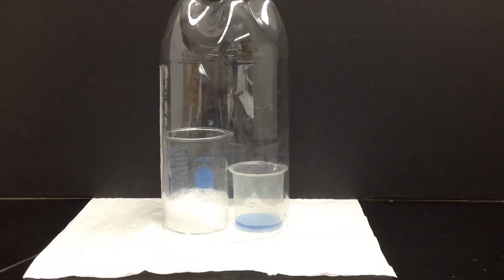So there's all kinds of frothing and bubbling going on over there, and that's an indication of a chemical change. There were no bubbles, and now there are bubbles. That implies a new substance is being produced or released when that Alka Seltzer tablet gets dropped into the water. So we have some observations about the beaker on the left, the tall beaker with the Alka Seltzer tablet in it.